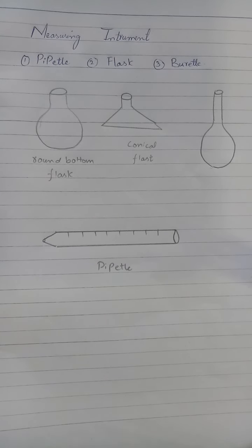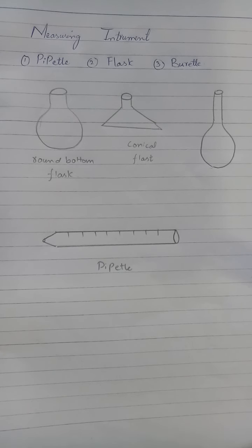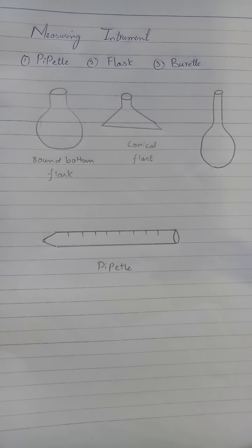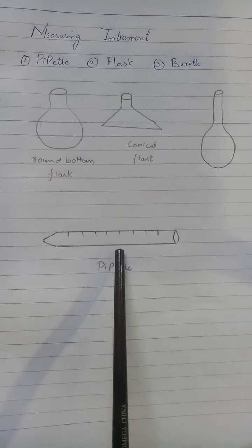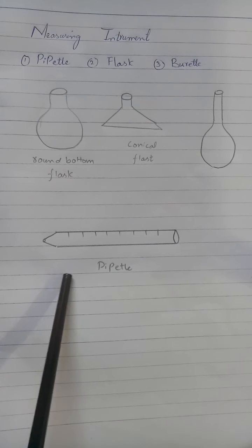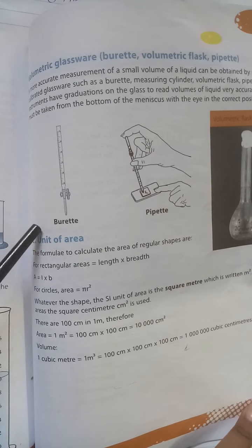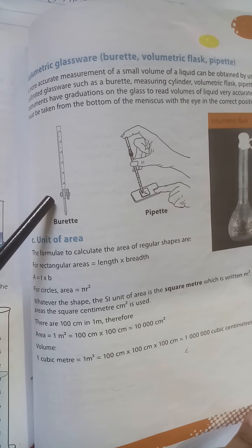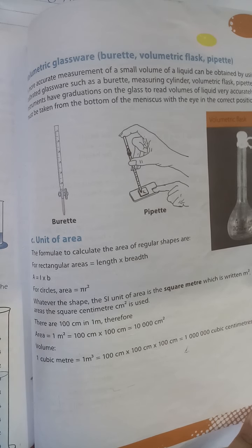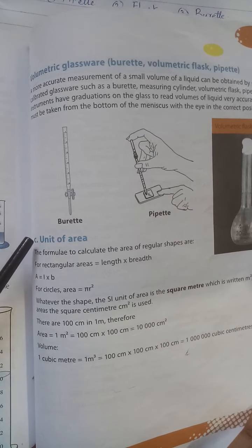Next is the pipette. If we need to add a small amount of liquid — just a drop or two — we use a pipette. We can use it with a flask or conical flask. We add volume drop by drop. The burette, which you can see from the diagram, is also a volume-measuring instrument. You fill a liquid or solution in it and add volume drop by drop to another solution.